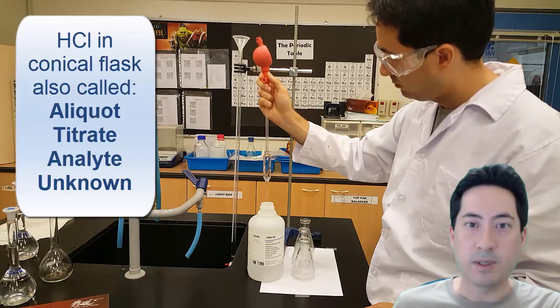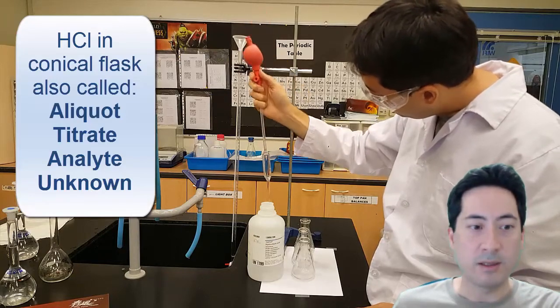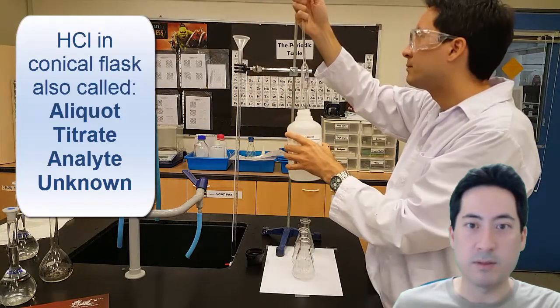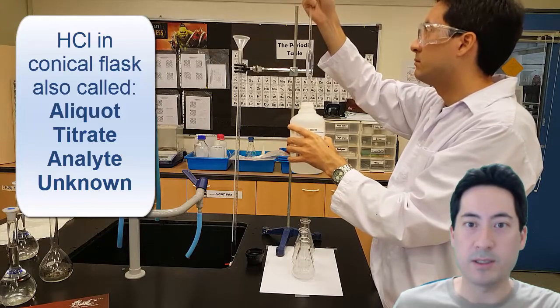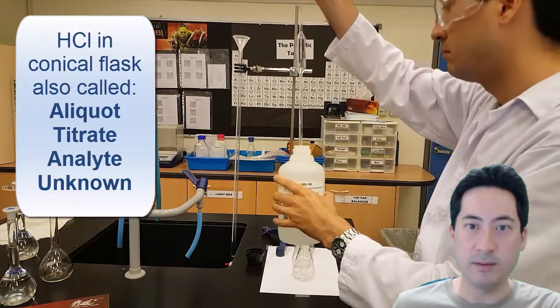Now what I'm doing here is I've just rinsed it out with water and I've just rinsed it out with the aliquot, with the substance itself as well. So it's been rinsed with HCl. This is to make sure it's completely clean, there's no contaminants in there.